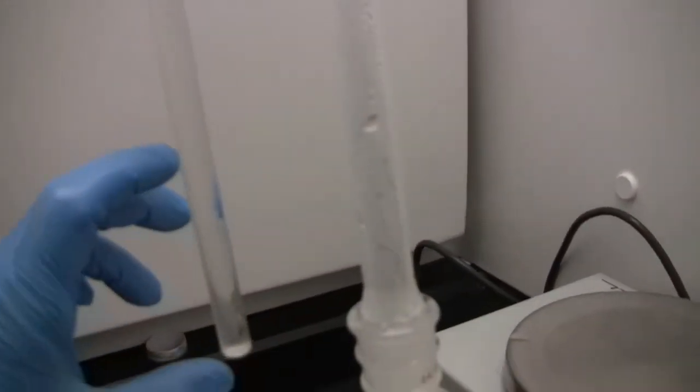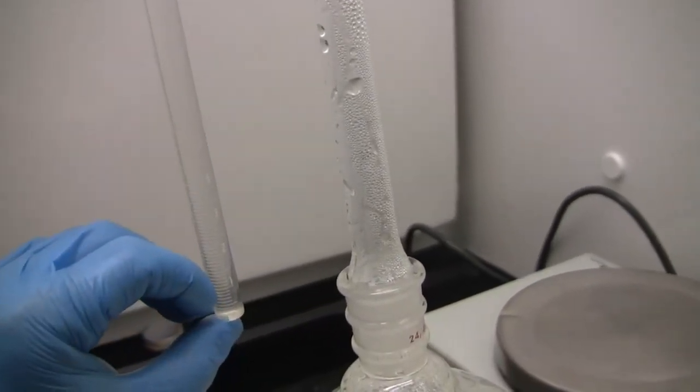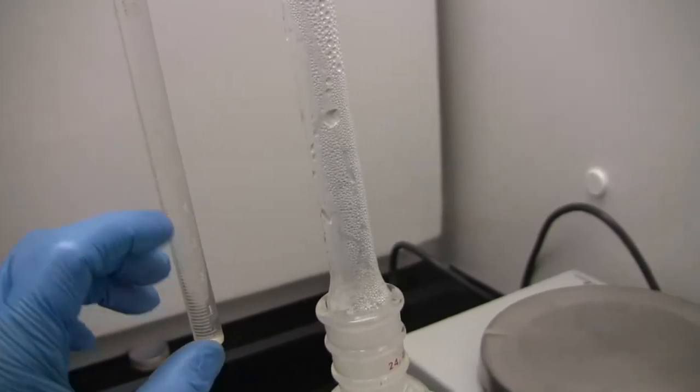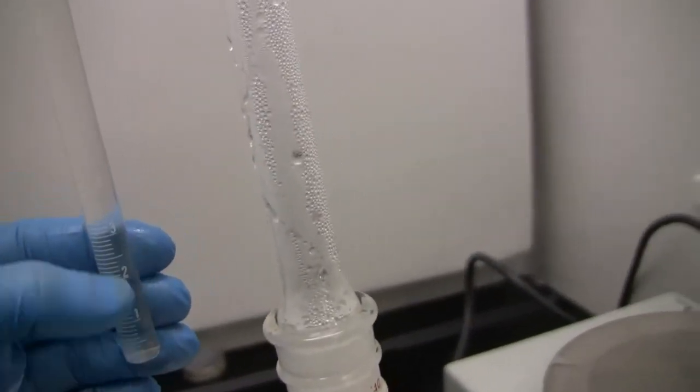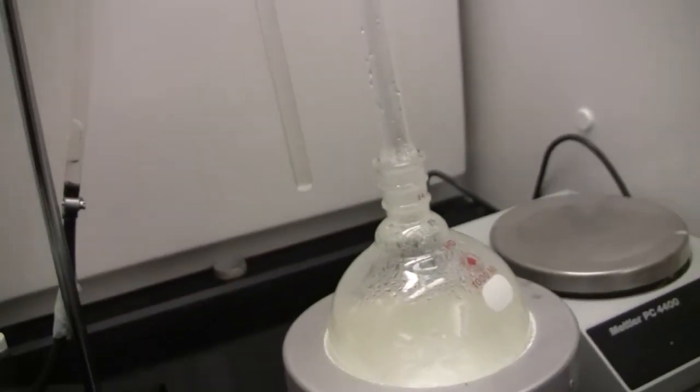In the end we will find two fluids here. One of them is the water, which will have a smaller level depending on its saturation, and the rest will be full of toluene and oil. You will see that this is a graduated cylinder, so we'll measure the volume of water and give you this volume. This is a summary of this experiment.